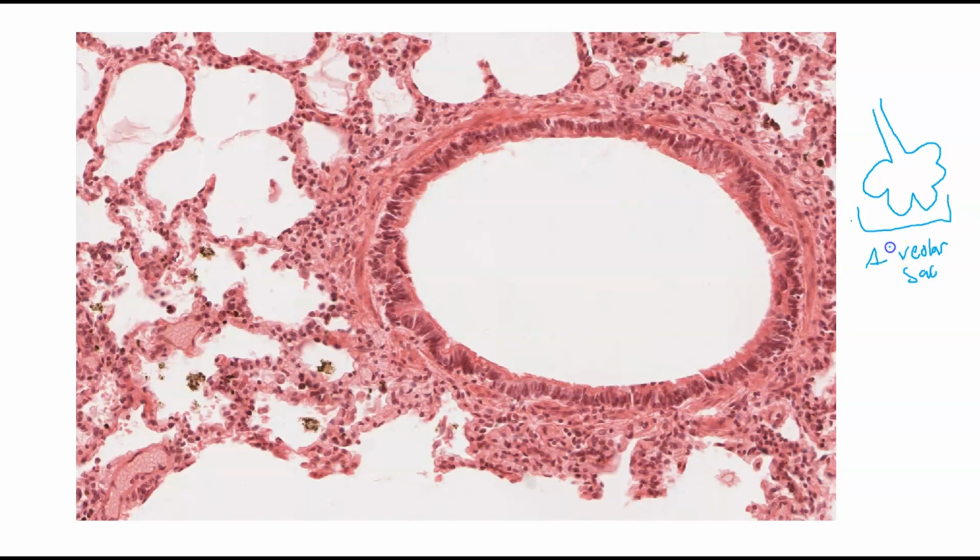All right, the alveolar sac is made up of individual alveoluses. Alveoli for plural, alveolus for single. So this right here is an alveolus, which is what you see right here. Just one of those little dimples in this alveolar sac is an alveolus. Here's a nice one right here, another one right here. So these are all alveolus.